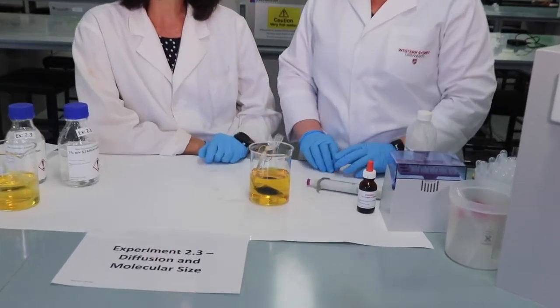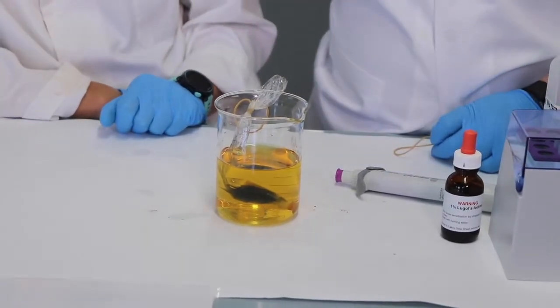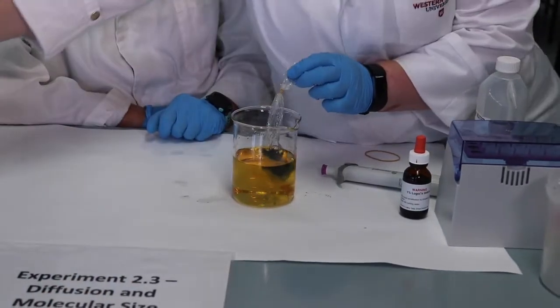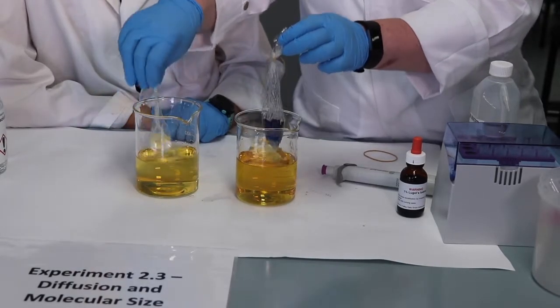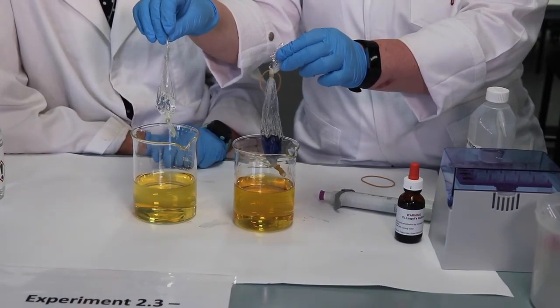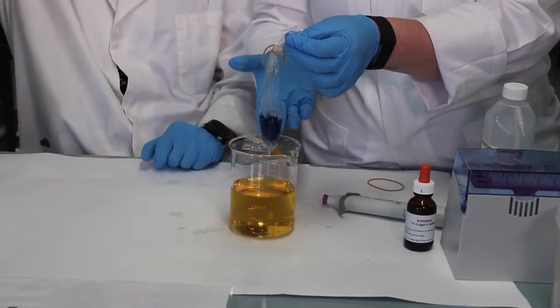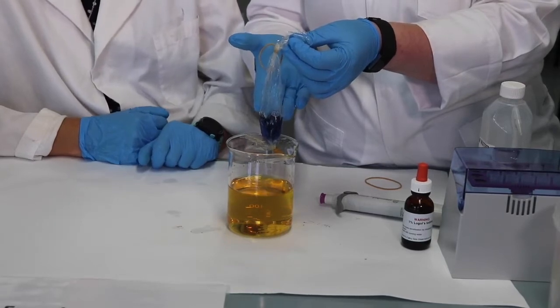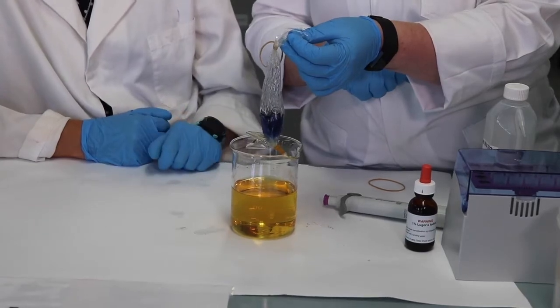If starch, which was inside the bag, moved out, would you expect to see a colour change? Have a think about that. But what is different, and we can probably just grab our original one as well, is the actual bag contents. We started with a clear mixture of glucose and starch, but now we have this blue-black mixture. So what must have happened for this mixture to have turned blue-black? Remember, iodine is in the beaker and starch was inside the bag.